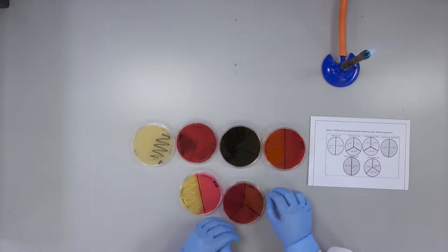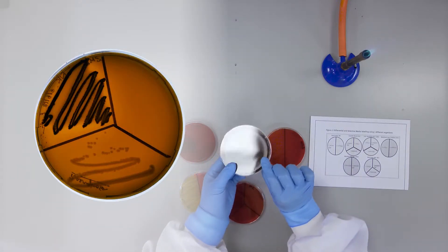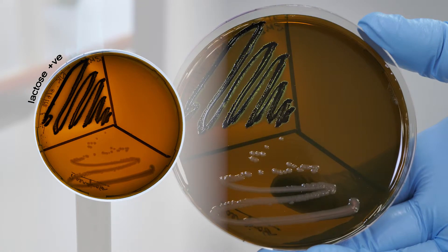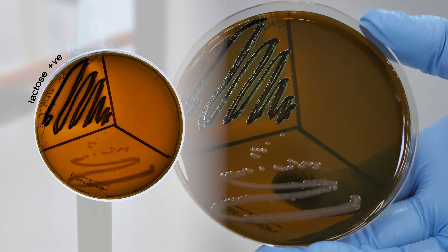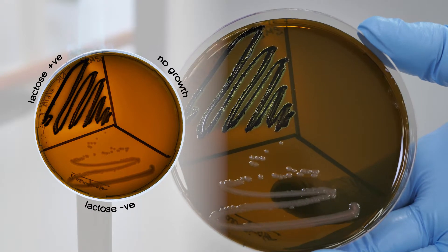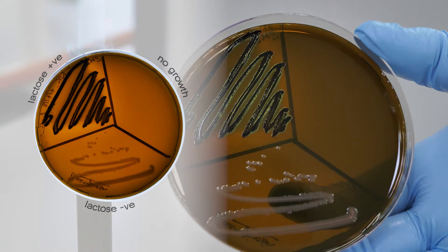Eosine methylene blue agar contains dyes that inhibit the growth of most gram positive bacteria. Lactose positive bacteria produce a metallic sheen and lactose negative bacteria are colourless. No growth of a bacterium indicates it is inhibited and is gram positive.